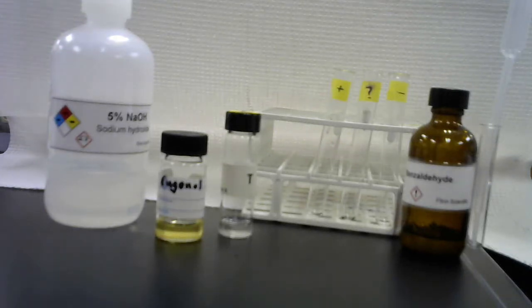Next, we'll look at the solubility test of an unknown liquid in sodium hydroxide. Again, like all the qualitative tests, you need to do a known positive, which you know to be soluble, a known negative, which you know to be insoluble, and an unknown that you're testing to determine is it soluble or not soluble.